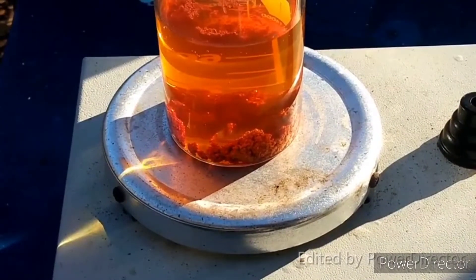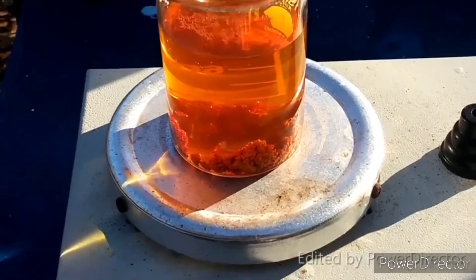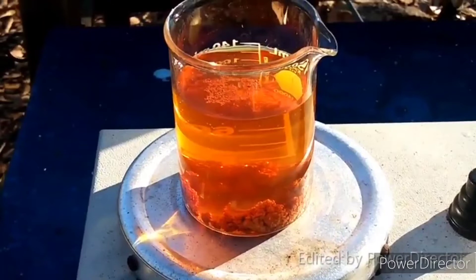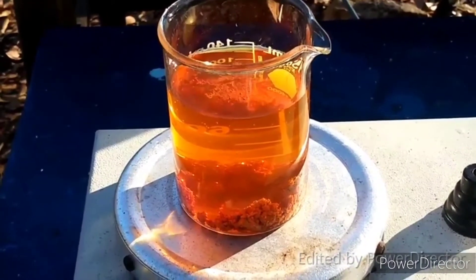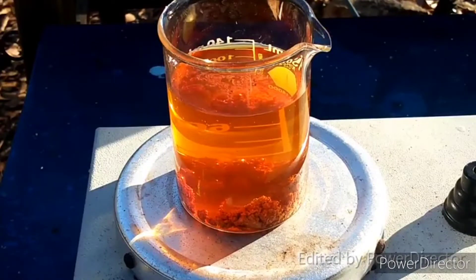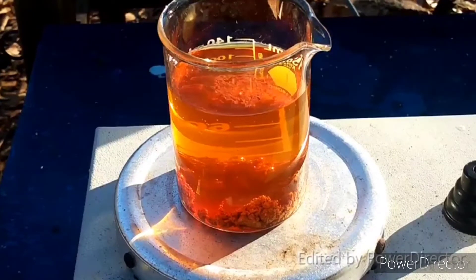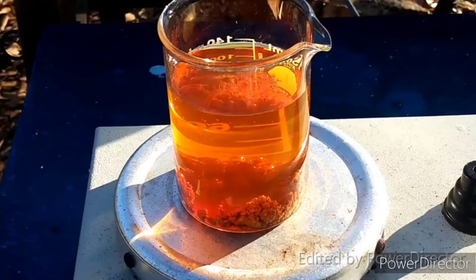What I'm going to do here is heat this up and stir it to try to get as much to dissolve as possible. Then we are going to react it with some hydrochloric acid and sodium sulfide to precipitate out arsenic trisulfide. This should be a very simple and straightforward process. The ultimate product of this hydrolysis is supposed to be arsenic trioxide, so if it fails and produces arsenic trioxide, that is still a win.